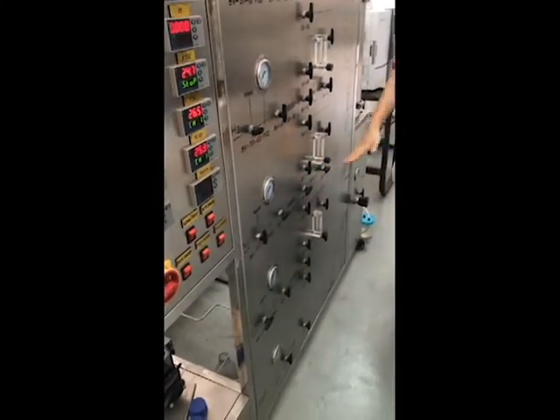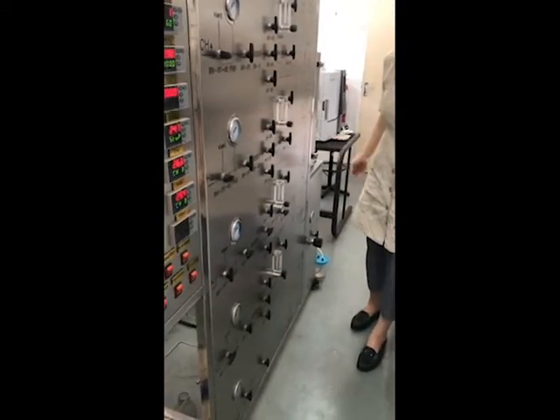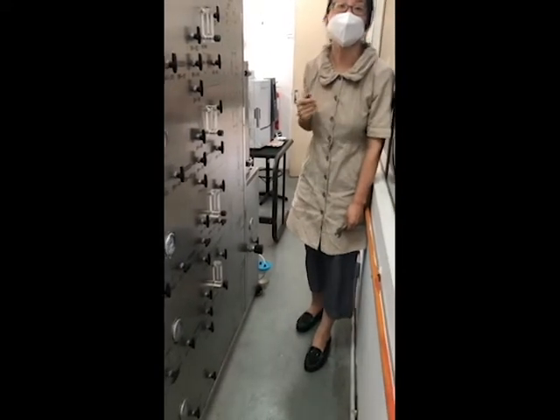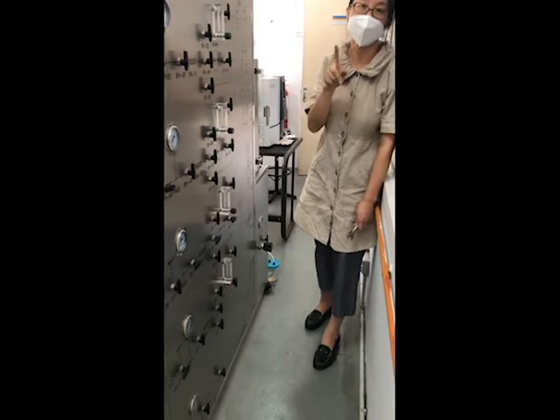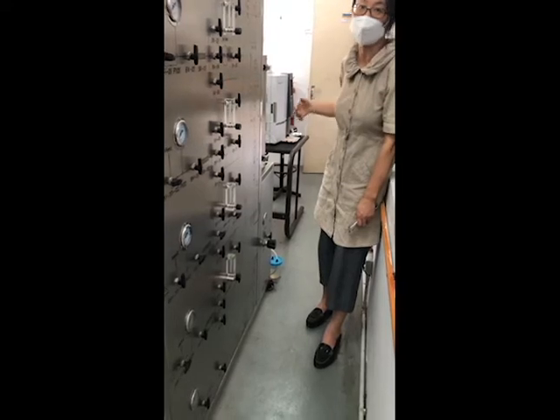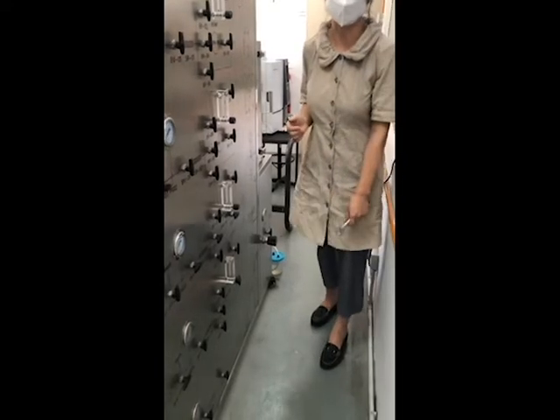Now you have finished adjusting for the nitrogen. This is the first step: you are charging the system with nitrogen. At this moment, as we were just discussing, you can do the washing of your gas bag. But you don't wash at the beginning, because you will charge the nitrogen for one hour; maybe after 20 minutes, when the full system has been charged. Otherwise the residual air inside the reactor will come into your gas bag. So you can wash your gas bag during this stage.